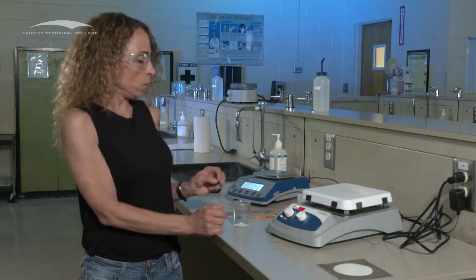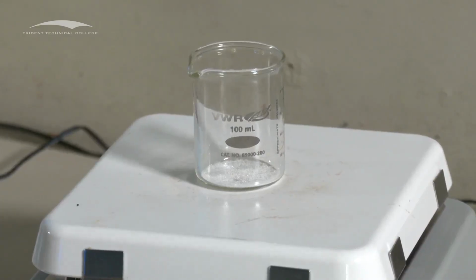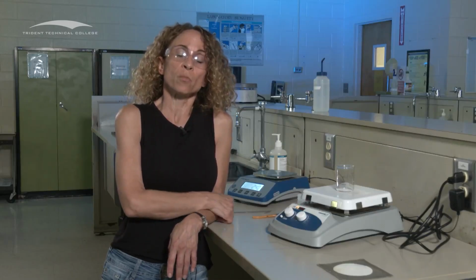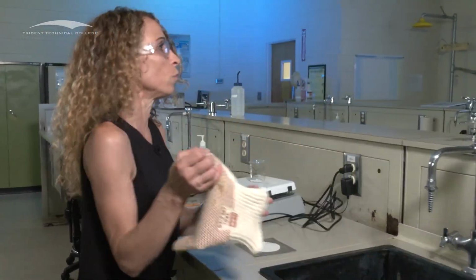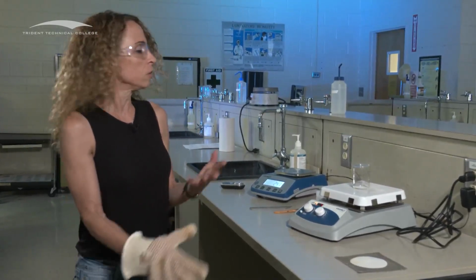You're going to take your beaker with your solid and put it directly onto the hot plate. You're going to let it stay there for however long is specified in the procedures, 10 or 15 minutes. And then you're going to remove the beaker off the hot plate. But if you touch this beaker, you're going to burn your fingers. Don't do that. You can use an oven mitt, which we have right here, or you can use beaker tongs, which are in the lab as well. But you do not want to use your hand unless you want to burn your hand. Take it off.